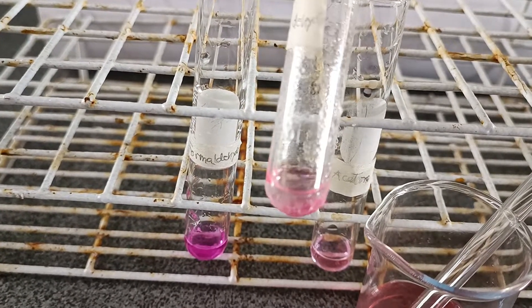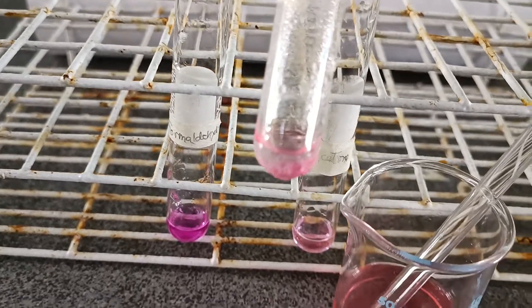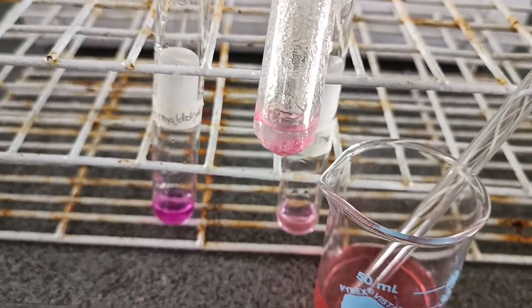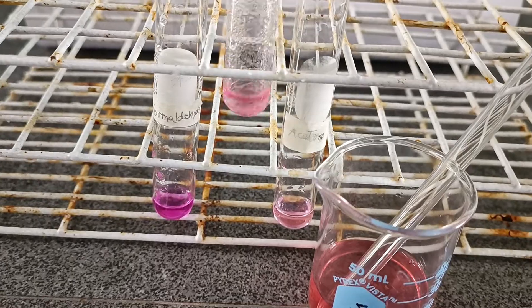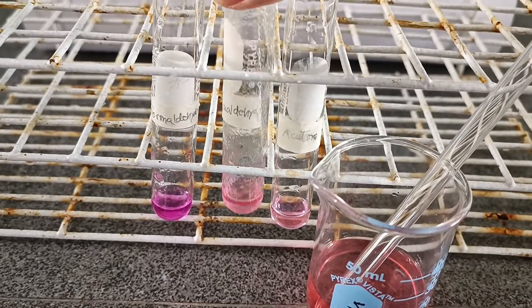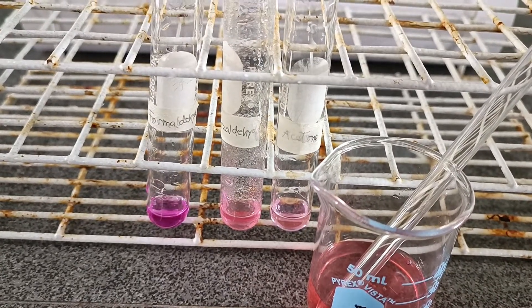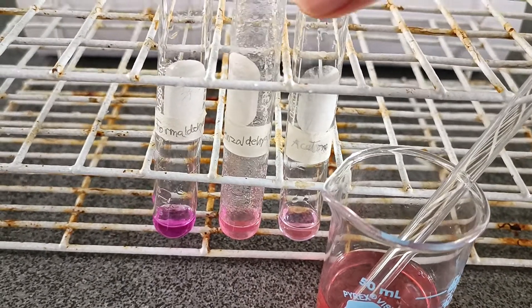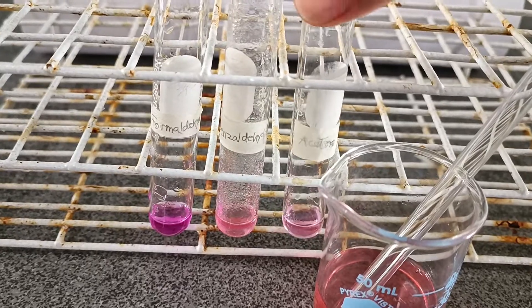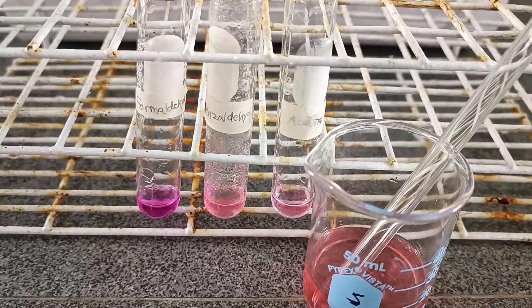There, a magenta colored product. So the Schiff's test will give a positive reaction to aliphatic aldehyde and aromatic aldehyde, but negative to ketone. Thank you.